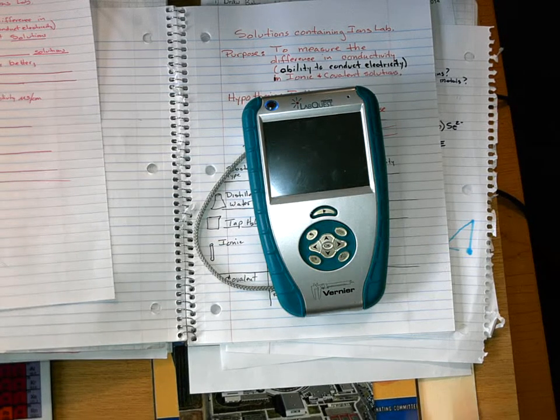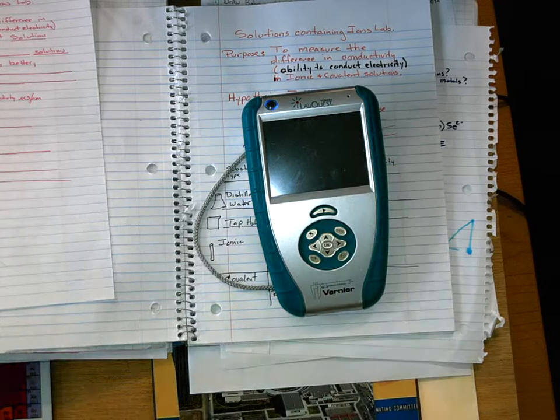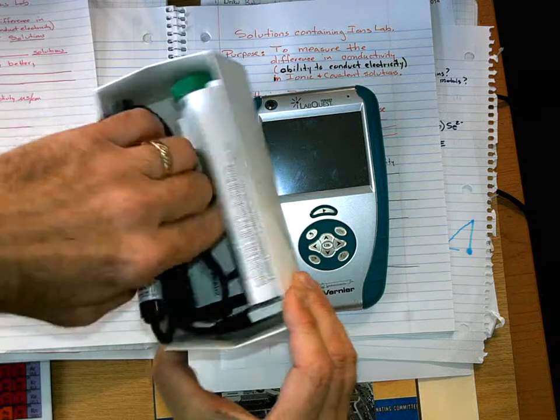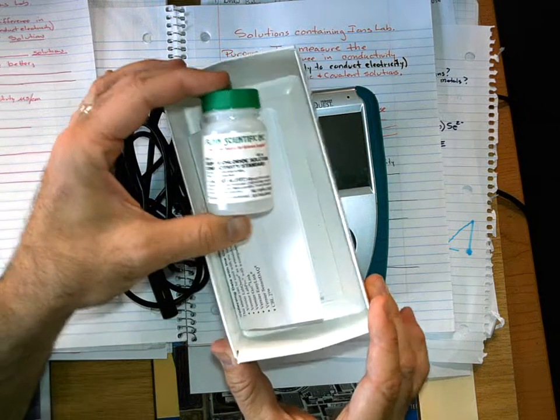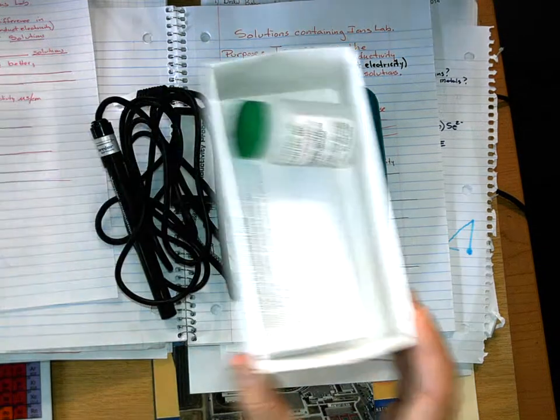So this is going to be the probeware we're working with. In a few minutes, you'll go back and get one of these setups from the back table. You should have already opened up this box that says probeware. We're going to carefully take this out. Please be careful with the equipment, I know you will be. There will probably be a container of a stock solution. Please don't mess with this. Make sure the cap's still on tight. We don't need to work with that here.